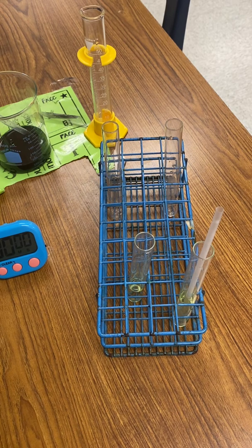Anyway, that's our cellular respiration lab, just proving that our body produces CO2. The idea is that when you exercise, you bring in more oxygen, therefore you're gonna output more CO2 because your body needs it for energy. You should see a faster time the second time around.